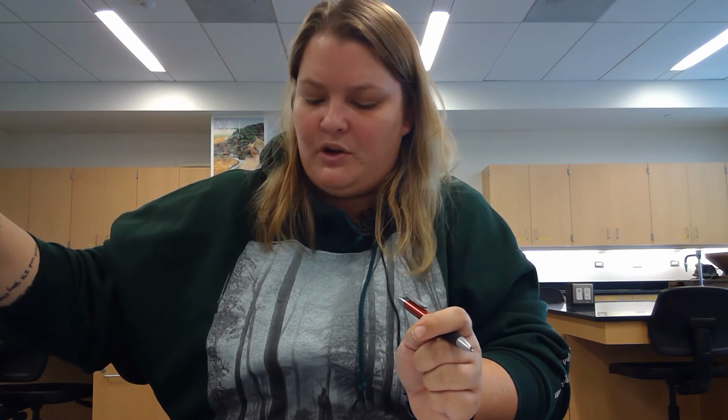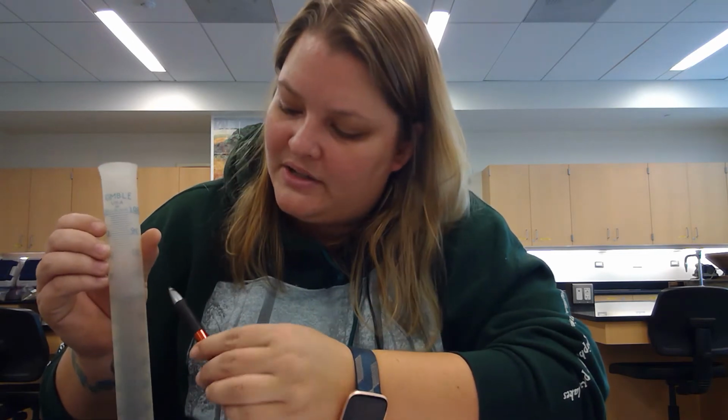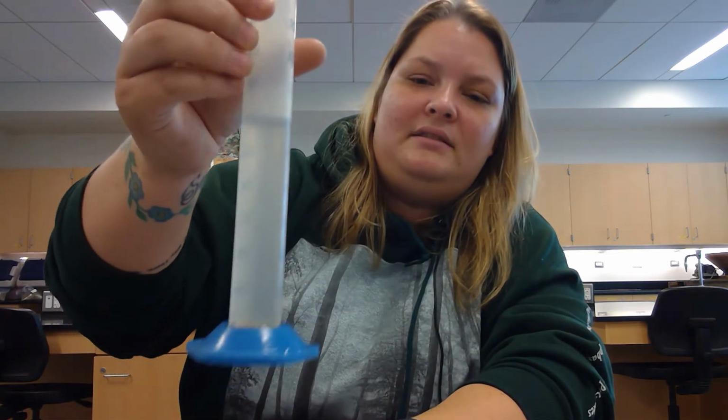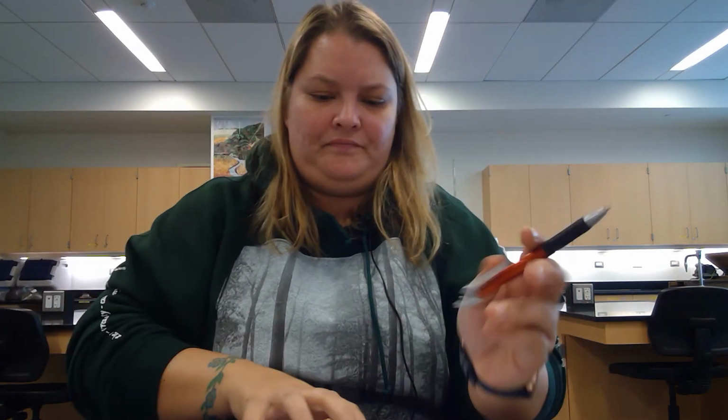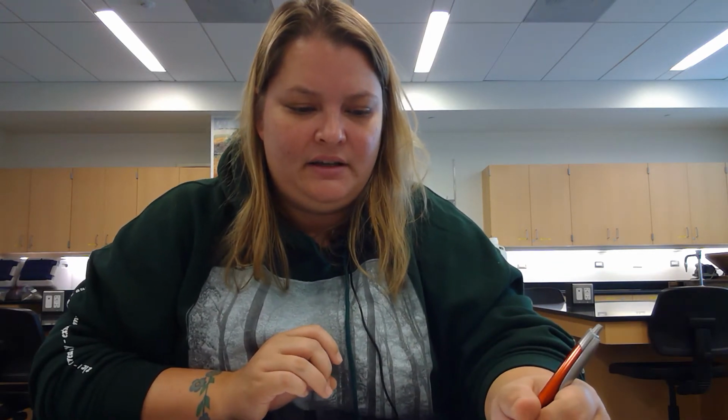We do get pretty close. So I'll leave you to figure out that equation yourself. You can maybe barely see that, but we were pretty close. And I dumped some water out on the table, but on accident.